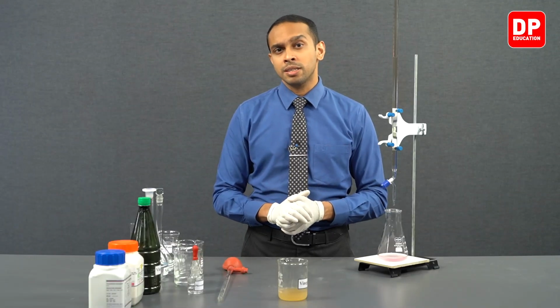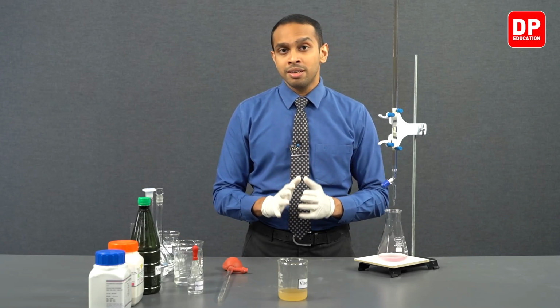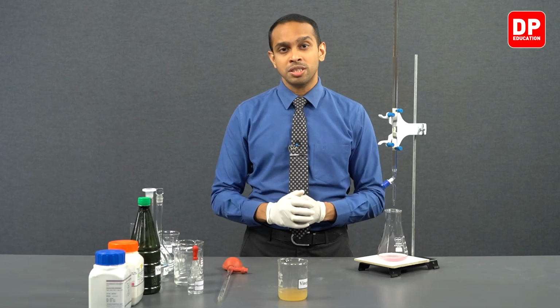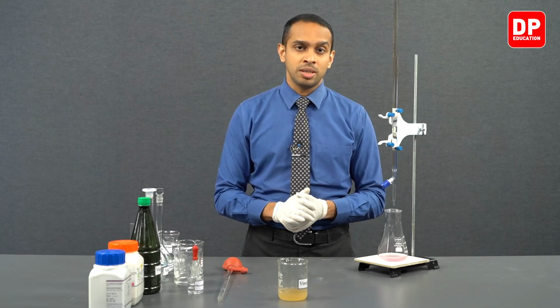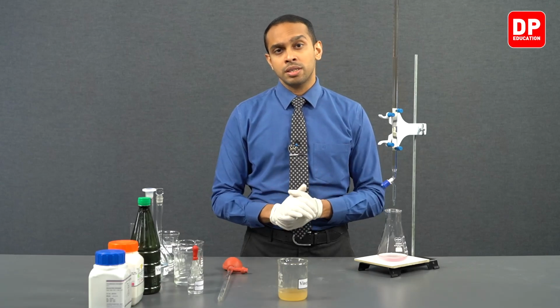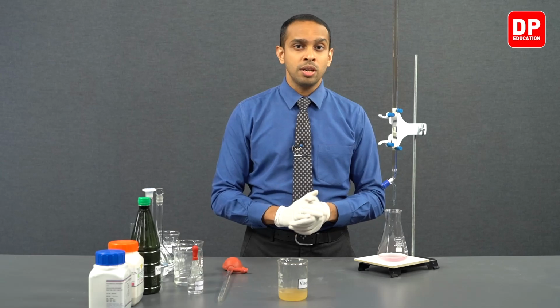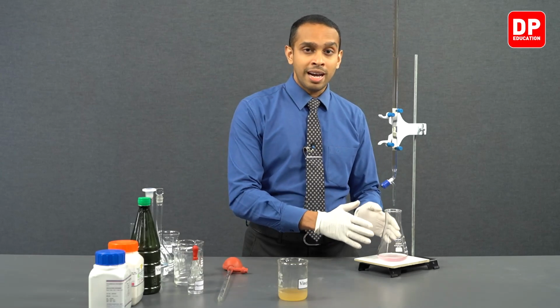After standardizing the sodium hydroxide solution, we have to calculate the actual concentration of sodium hydroxide solution. After calculating the actual sodium hydroxide concentration, we can use that solution to titrate the acetic acid in vinegar.